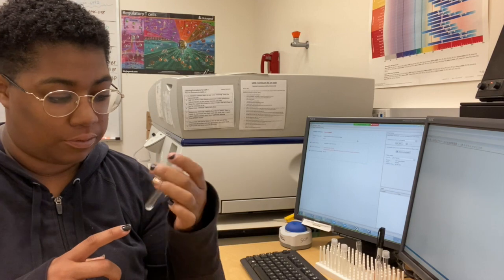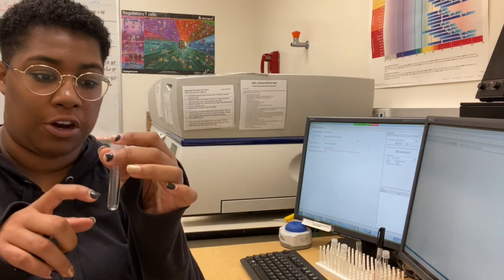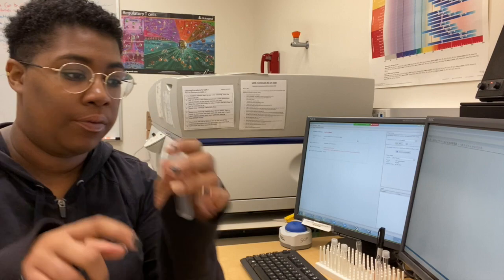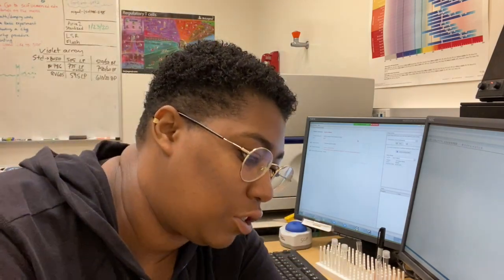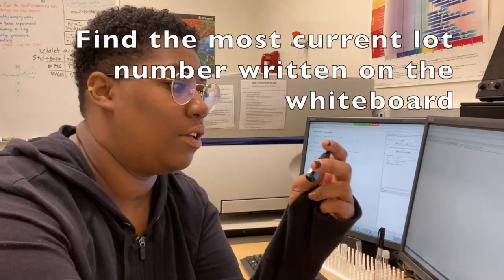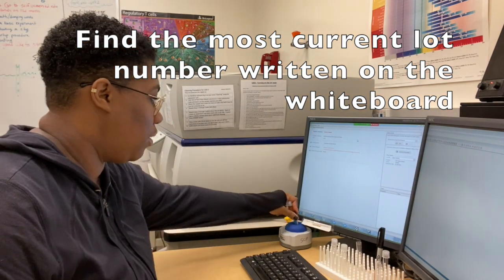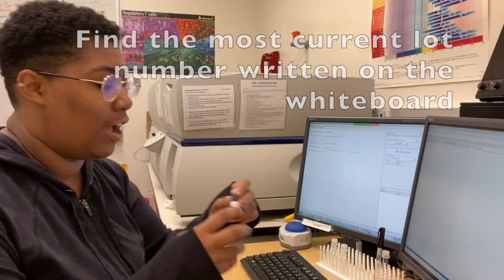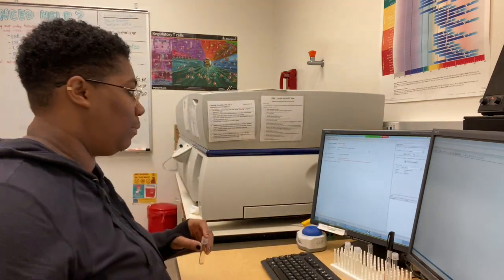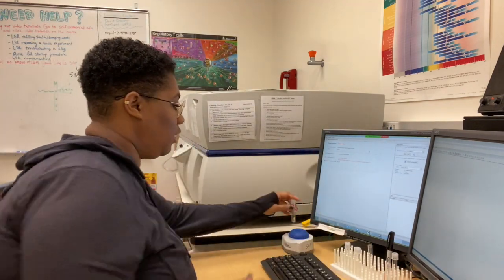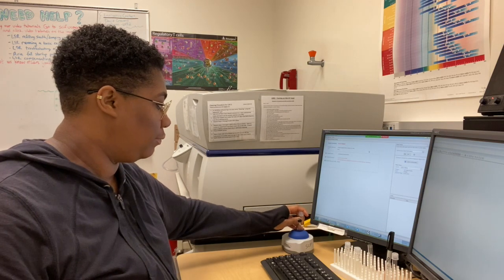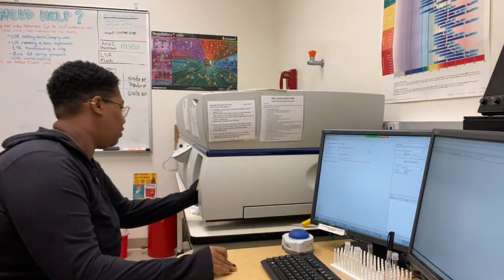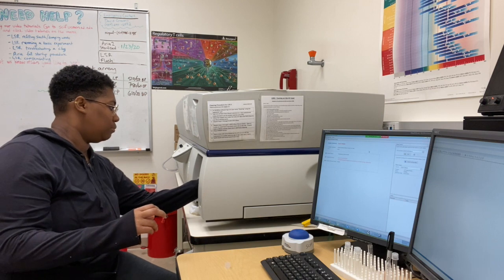Put drops of water, about six drops of water until it comes to around here. Then you would want to grab the bead lot, make sure that you spin it and add two drops. But since we already have one made, we will make sure it is spun and put it onto the machine.